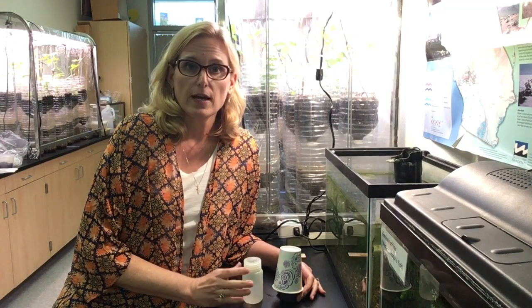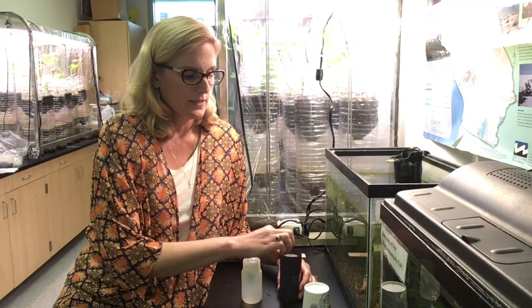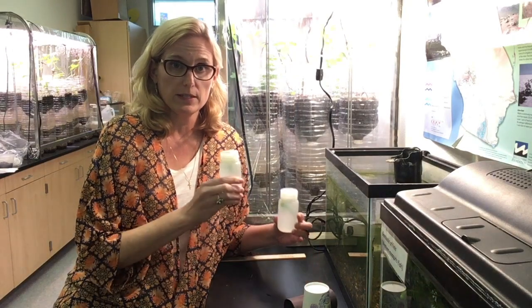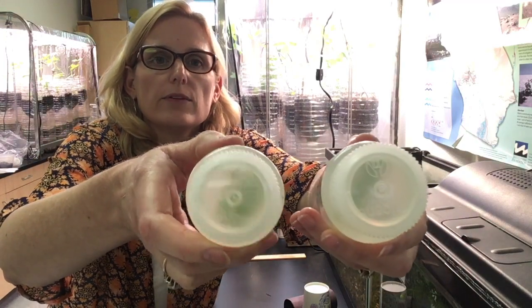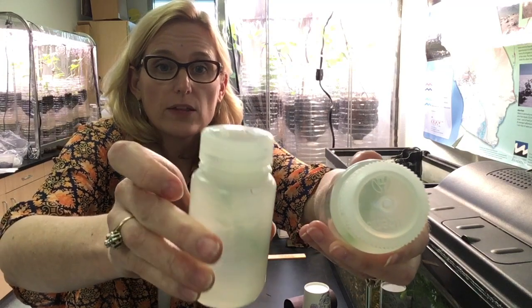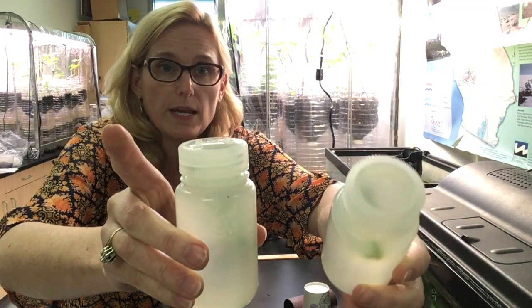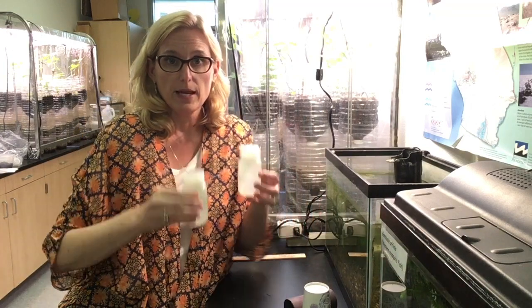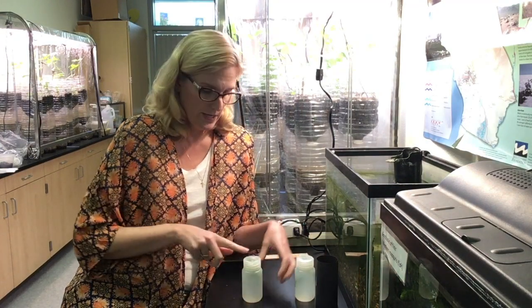It's been 48 hours and I'm going to take a look at the dissolved oxygen levels in each of the two bottles. I have the bottle that was in the dark and the bottle that was in the light. Looking at the one in the light, there are actually air bubbles at the top — it looks like the elodea plant has made some oxygen, because at the beginning there were no air bubbles in either bottle. I'm going to make sure I don't mix up the bottles, so I'll keep the black paper near the dark bottle.